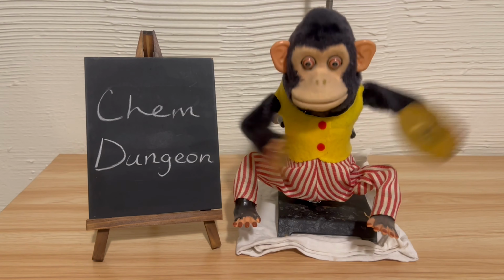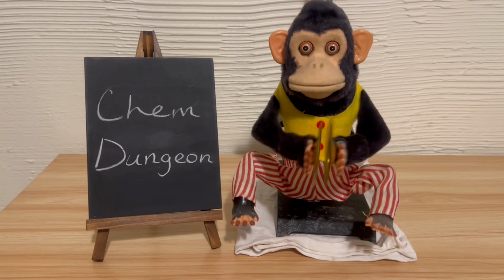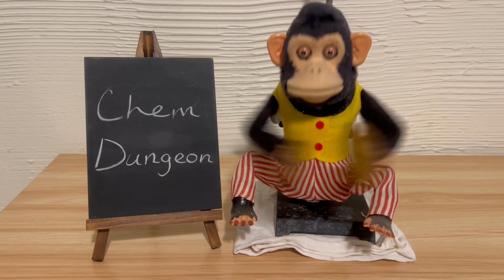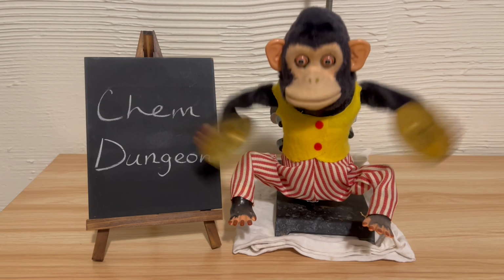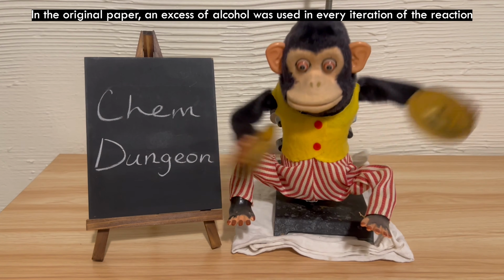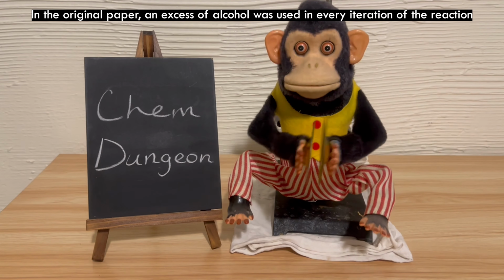but I didn't do that because toluene is cheaper than alcohol, and water is harder to remove from just ethanol. I don't think solvents were initially used, like toluene in mine, in the original paper. I think it was just alcohol, acid, and acid catalyst, but I'll look into it and then add text on the screen.